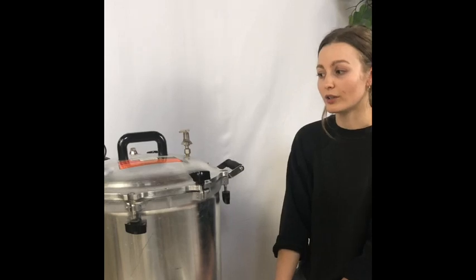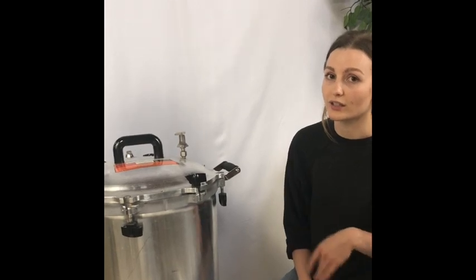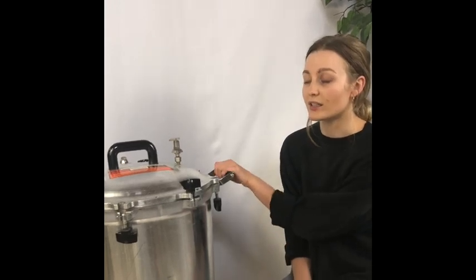Cook times vary depending on what you're cooking. For liquid culture — like this quart-sized jar full of distilled water and honey — we cook for about 17 minutes. For jars with broth and grain, we cook for 135 minutes. Agar we follow the recipe, but that calls for 45 minutes. If we're sterilizing tools, polyfill, and other things for bulk cultivation, we do about 2 hours. And if we get contamination in a jar, like trichoderma, we'll cook it for 2 to 3 hours.